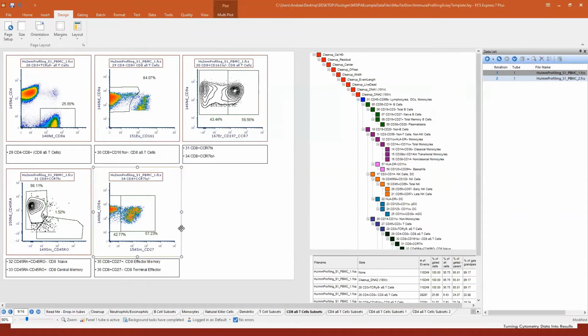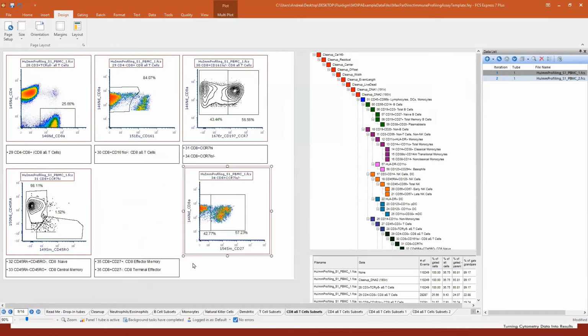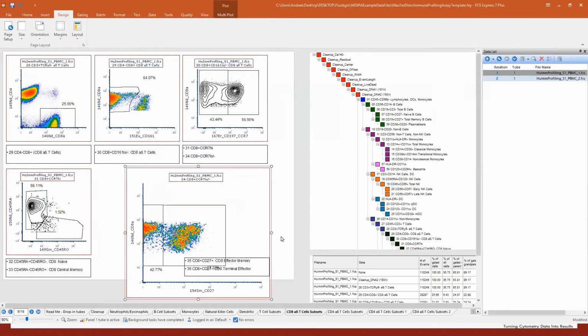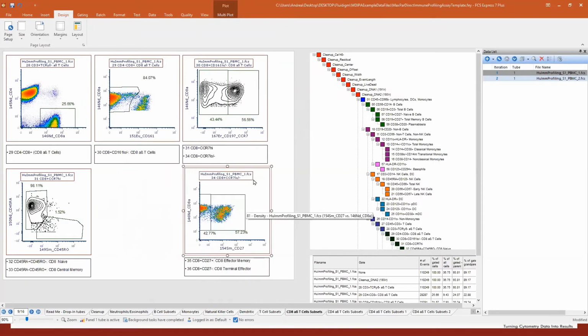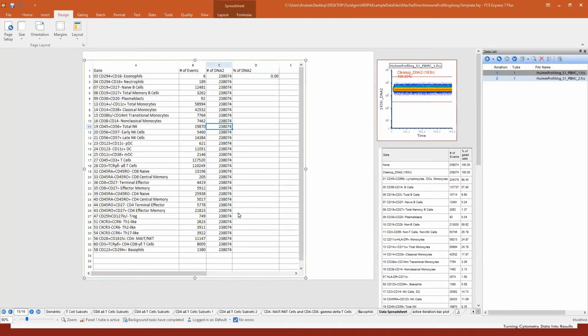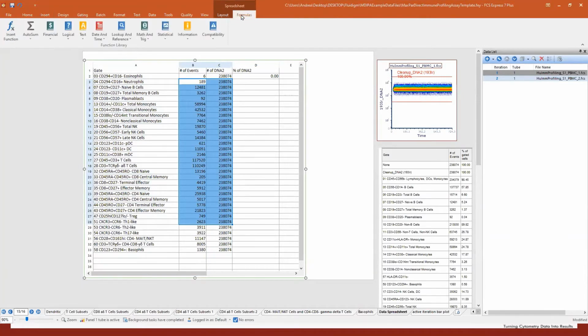If I want this plot to be here, that's fine. If I want to move a text box, that's fine. If I want to make it larger, that's fine. You have full control of the organization because again, this is data analysis and data reporting. And as I said, let me go to the last pages. In the last 2 pages, we have a spreadsheet. This is like Excel. You see we have different columns, different rows, and you have the ability to create formulas. We have a lot of formulas here.